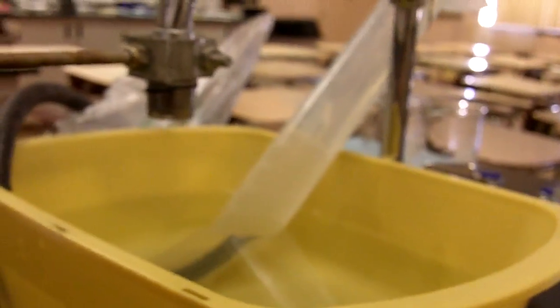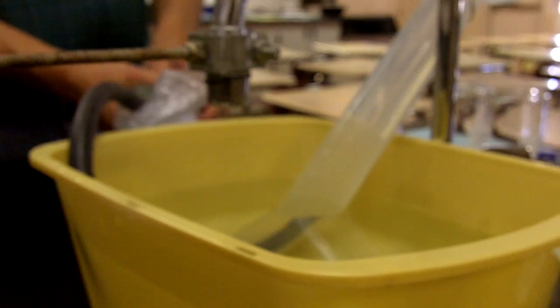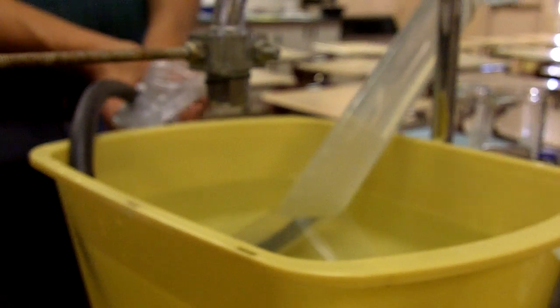What we're going to look at doing next is getting that baggie and the gas in the baggie squeezed through, and we should notice that we get bubbles of carbon dioxide gas going through the bag and through the tubing and into the graduated cylinder. And we'll see where we end up here. Just hold the end of it.